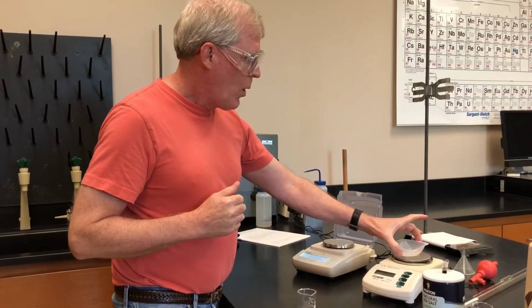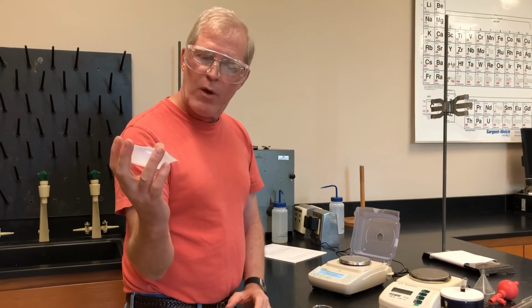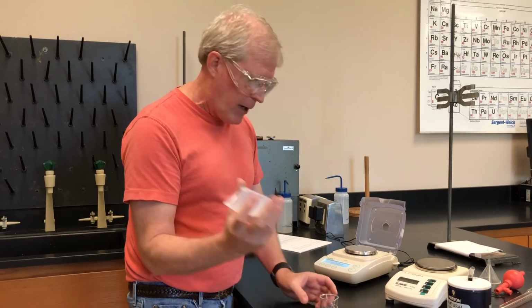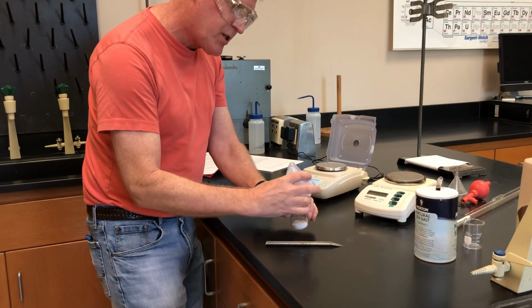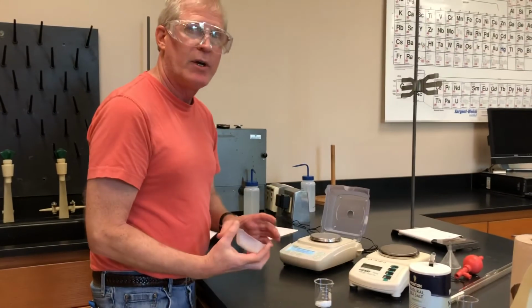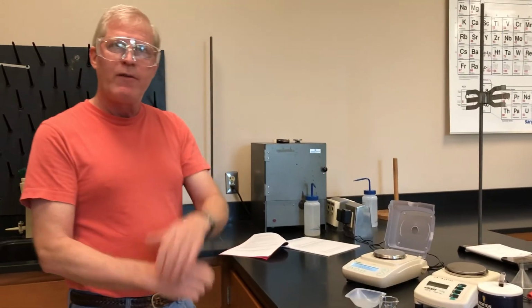So that finishes up all the weighing process. One of the nice things about these little plastic dishes is that you can fold them up like this, and you can pour this into some sort of reaction container or something like that. And it's very convenient for doing that. All right, there you go. So there's weighing out 0.5 grams of salt.